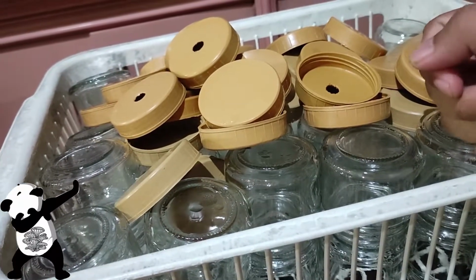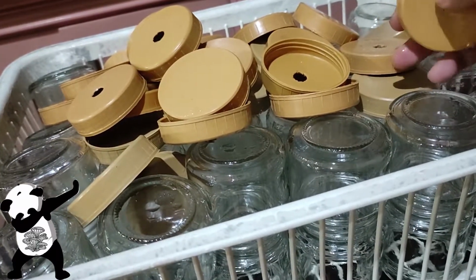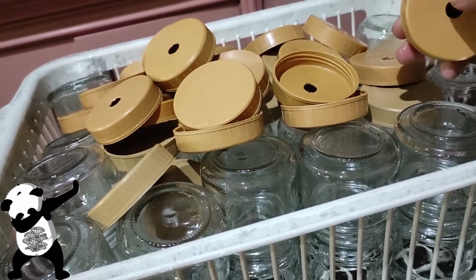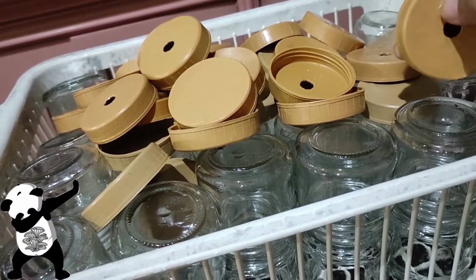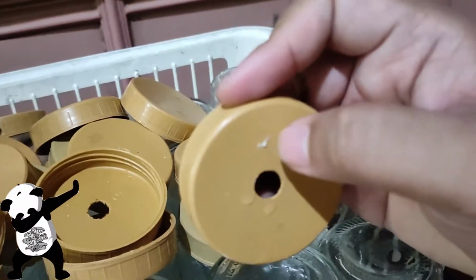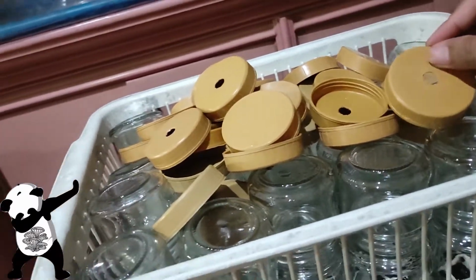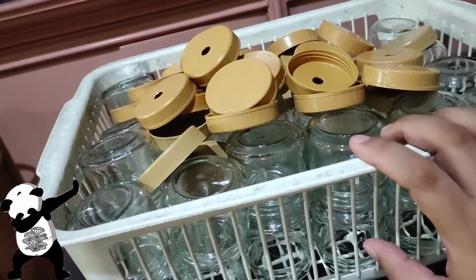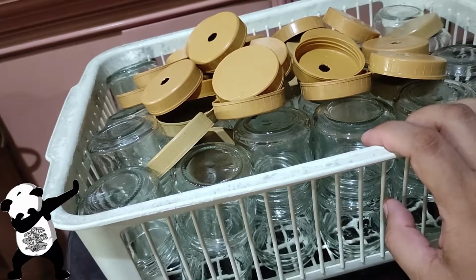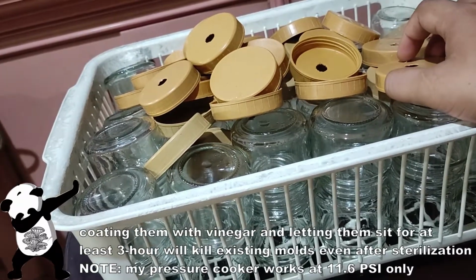These are the jars that I've soaked, not really soaked, but I did coat them with vinegar and I already rinsed them, so they smell good right now. And these are just part of the micropore tape that I'm removing, the part that was able to stick on my plastic lids. Later on I'm gonna clean this up and make PDAs.